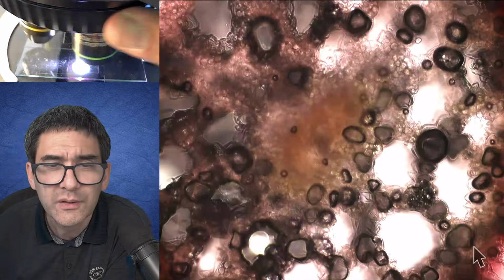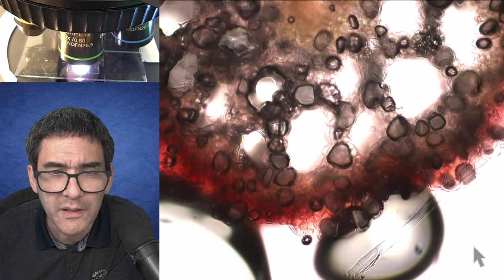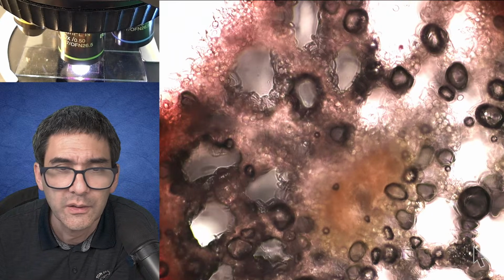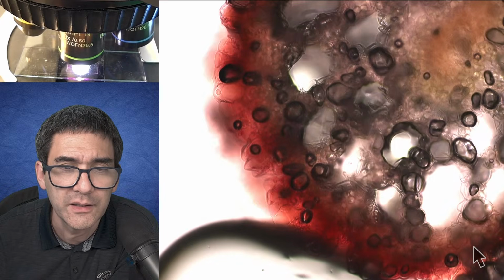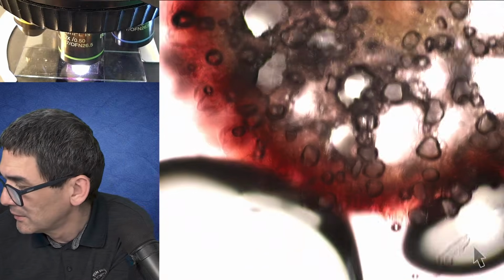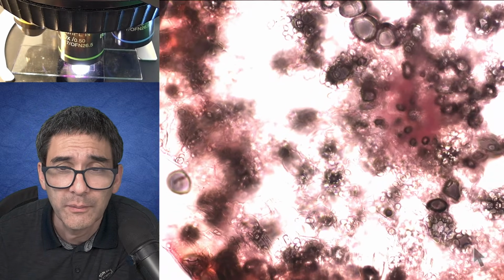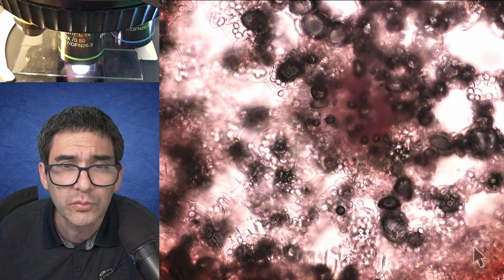What else do you notice? Okay, a lot of bubbles, obviously. But there is something else that you might notice, and that is the color. It looks kind of reddish, purplish, pinkish actually. The reason is that the glycerin gelatin had a stain added, and the stain now had enough time to actually stain the plant. I bought this glycerin gelatin to mount pollen grains, to also stain the pollen, and now you can see that it also stained the cross section here.